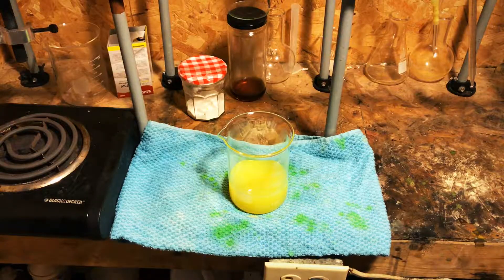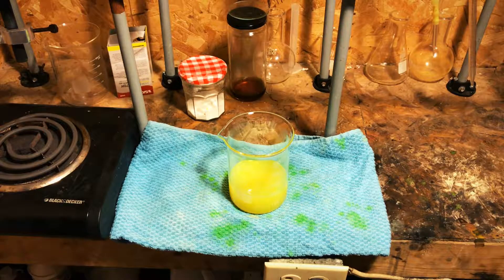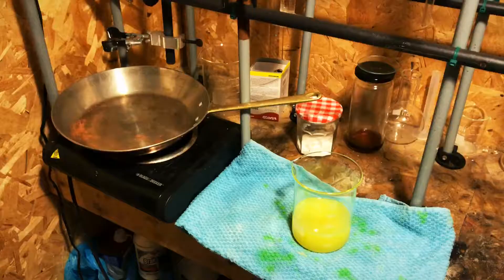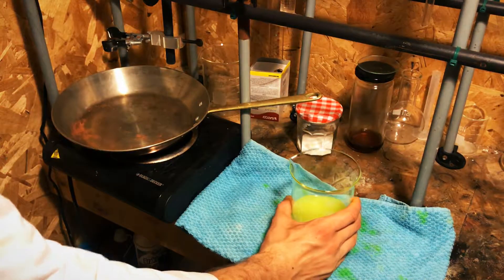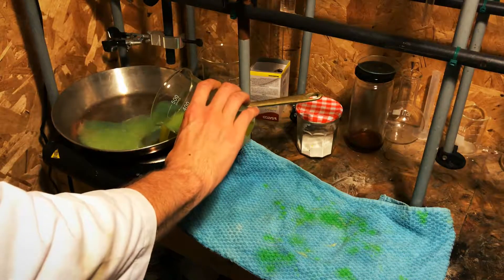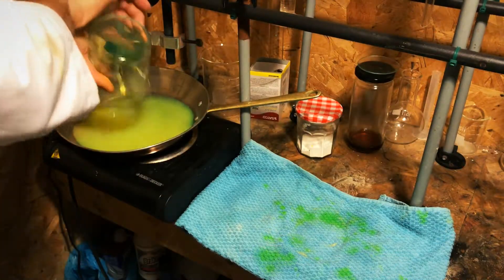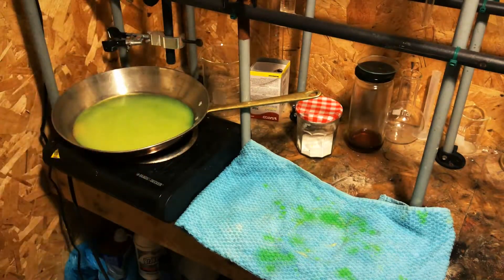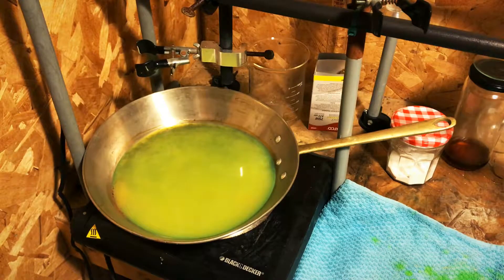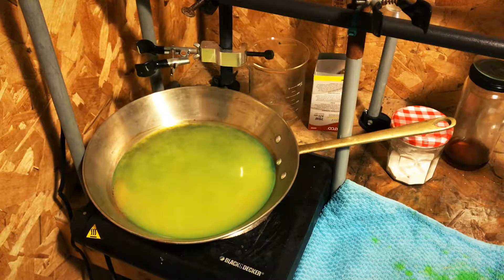What I have here is a solution of isopropanol alcohol — that's our solvent — and within the solvent is the fluorescein. I'm going to take the alcohol solution with the dye and pour it into this pan. First, you want it on medium heat. You don't want it too high — just at the right temperature for the alcohol to evaporate.